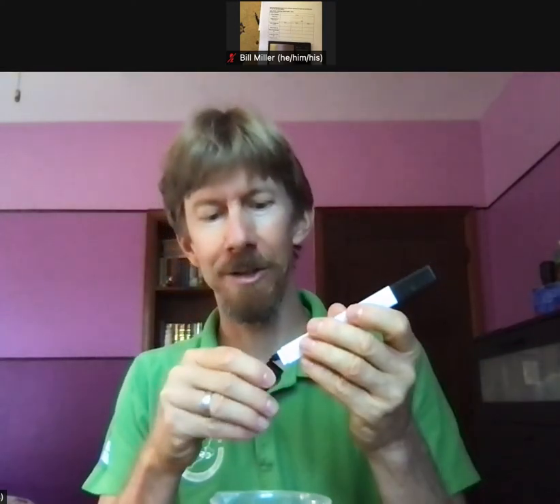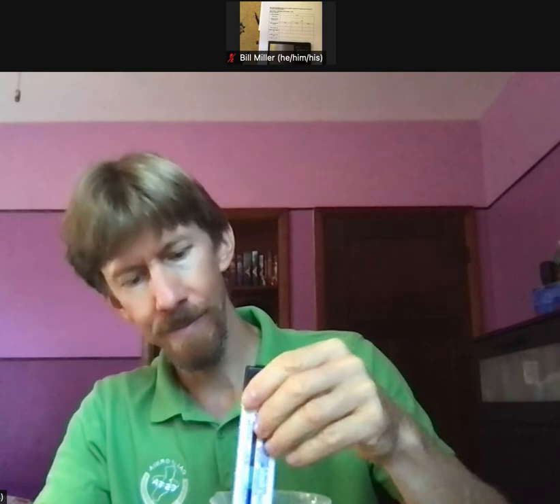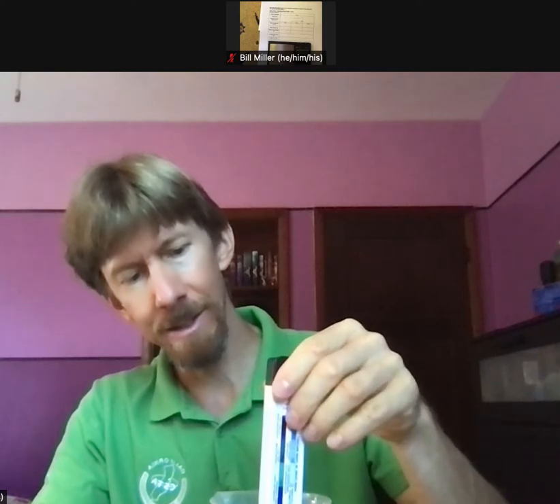I've equilibrated my water — that's number one. I'm going to record the temperature of my water. I'll turn on the thermometer, hit the mode button twice, put it in the water, and stir it until it stops moving. Since it was already at room temperature, it's not moving at all. For me, it's 20.4 degrees Celsius in my room.